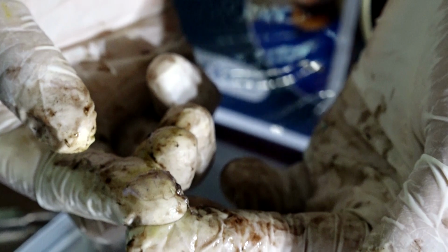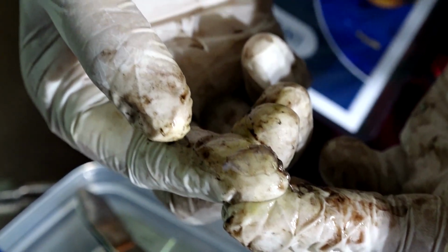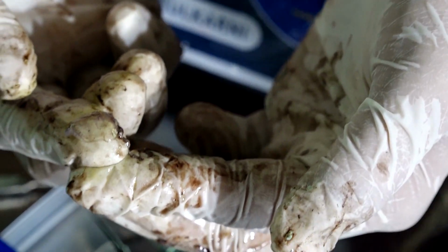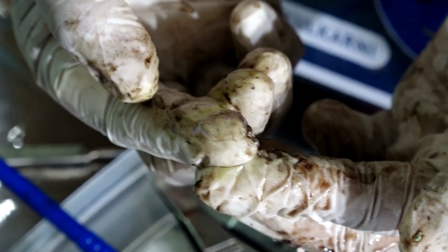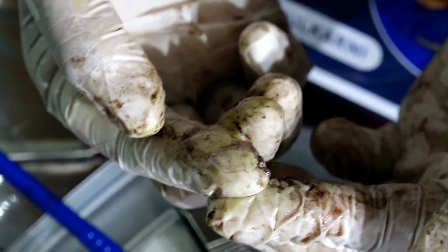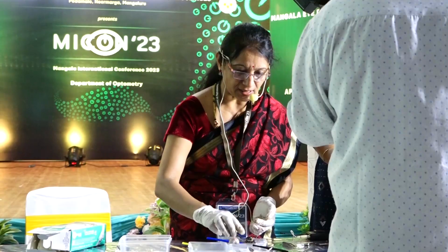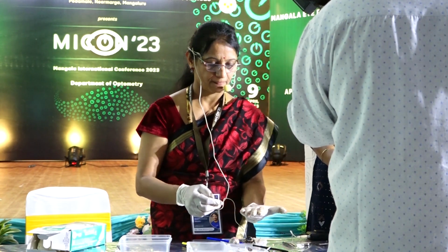What was this structure? The flat structure, a thin small structure, cornea. What is the thickness of the cornea? How thick is it? In the center it is only half millimeter. Try to imagine how much is half millimeter. And in the periphery it is close to 1 millimeter. So that is cornea. And what did you see here?